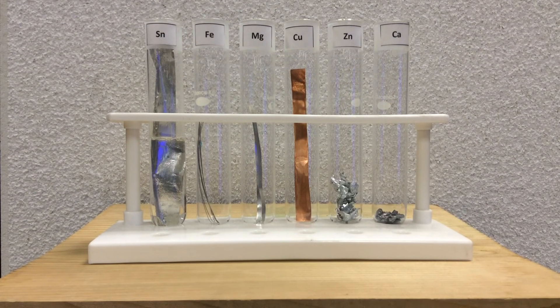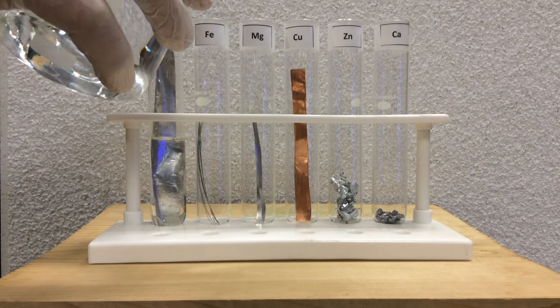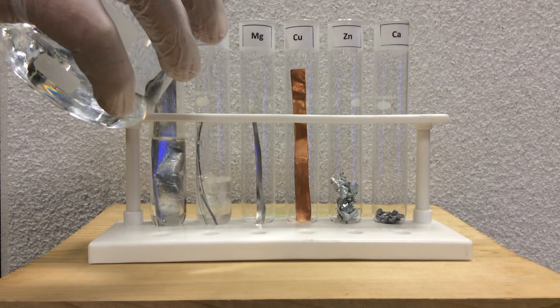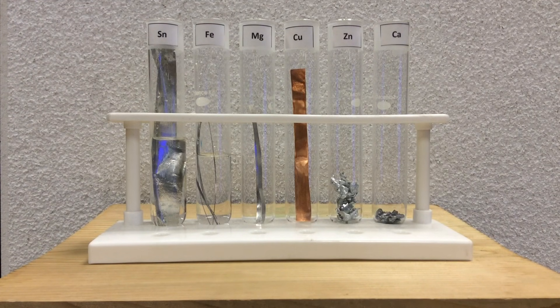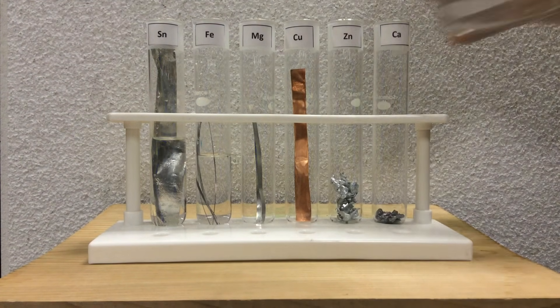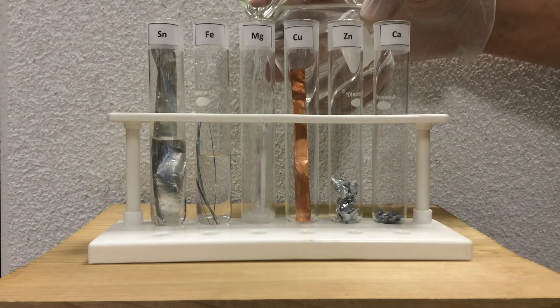As we can see that the reduction of the H pluses or the protons from the acid would make hydrogen gas. So we're looking to see basically which metal is the best at oxidizing.